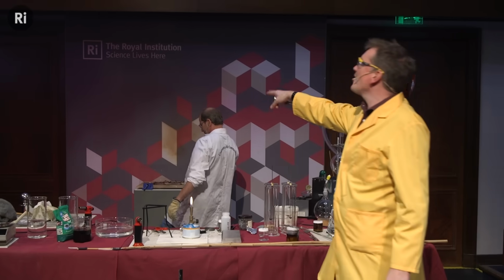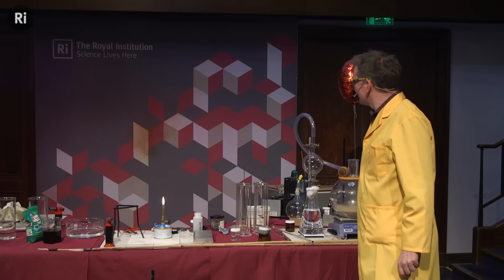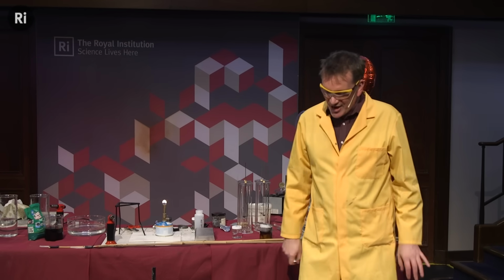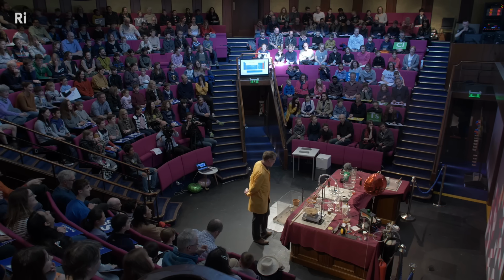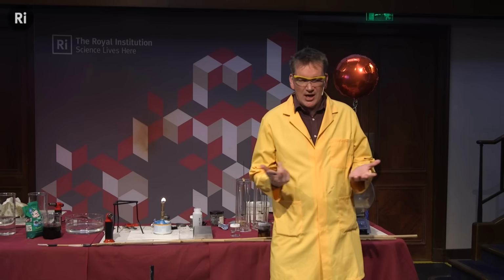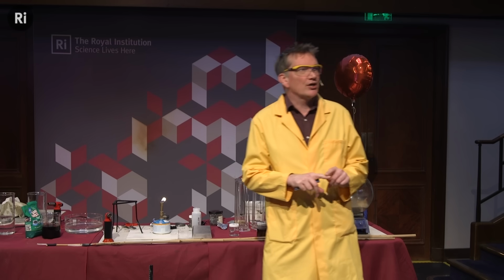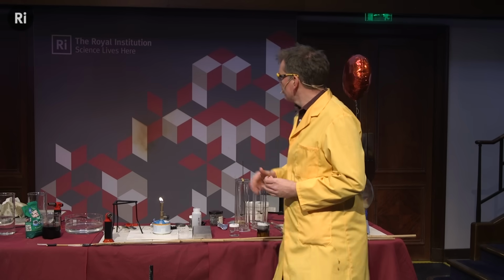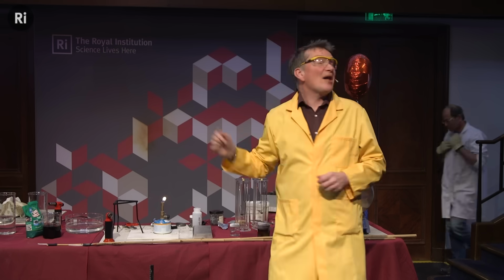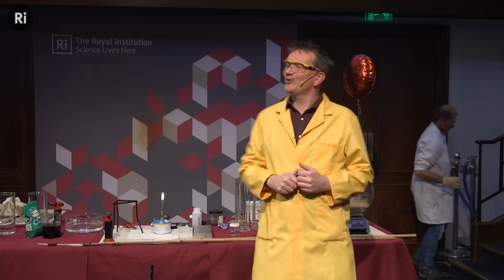So I hope you saw the nice violet cloud. Seemed to have changed the screen a little bit. Never mind. So iodine is, of course, something that you will be familiar with. Maybe you've got some at home in a first aid box. There's tincture of iodine. So if you have a cut, you can use it as a disinfectant. So when you have the solution, it has this sort of browny color. This is the color that we'll see on the screen. That will actually disappear gradually during the course of the lecture. It'll probably be gone by the end of the lecture, which is quite interesting.